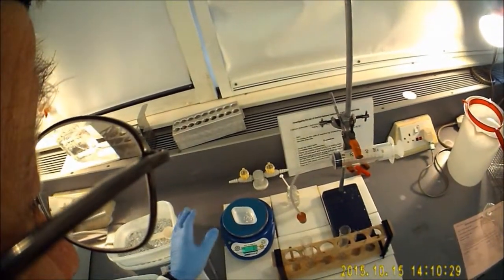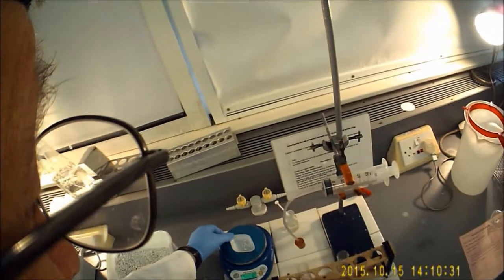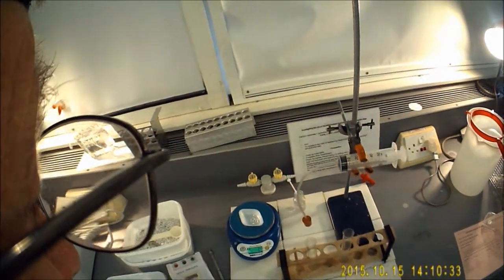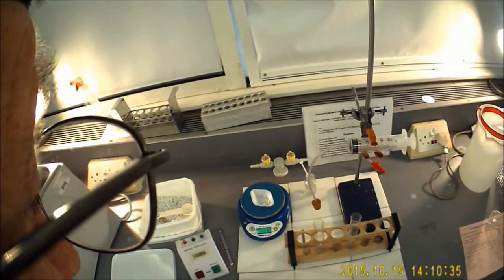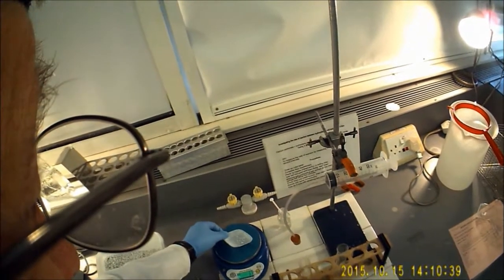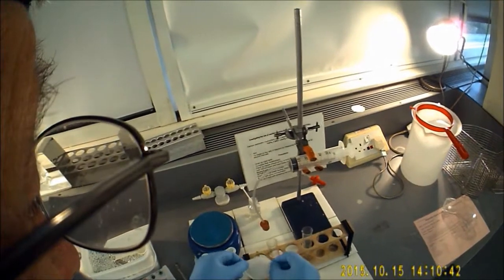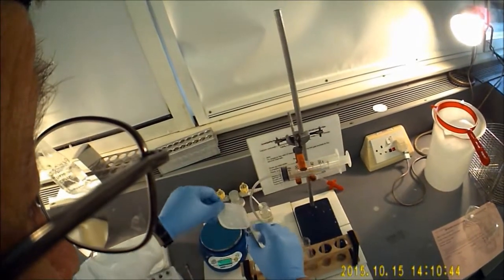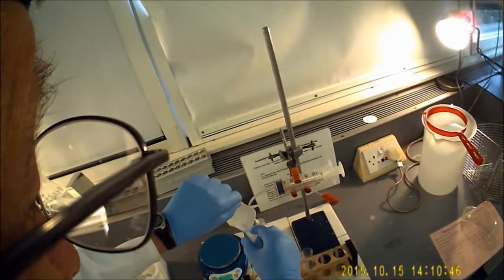It's just hovering just above, just below, but that's close enough. You will find if you touch the bench it actually affects the mass, so try not to create excessive drafts. The marble chips then go into the boiling tube.